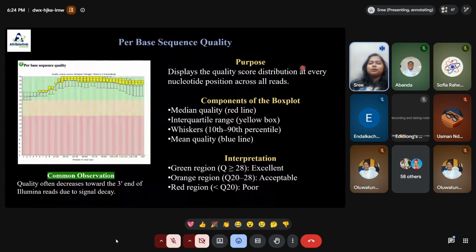So this displays the quality scores distributions across the different nucleotide positions. The x-axis is the positions of the reads in base pairs, and the y-axis represents the quality scores. And you can see three different layers of colors: a red region, an orange or yellow region, and a green region. In the red region, the quality is very poor. The orange region is acceptable. If the bar plots are all in the green region, it's excellent. The quality score is above 28. So we can consider that sample to perform the analysis. That is in the green color.